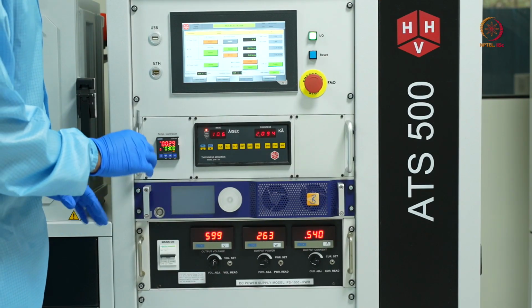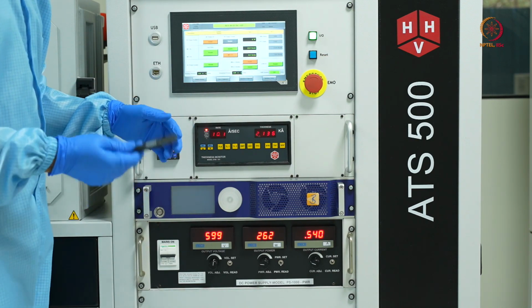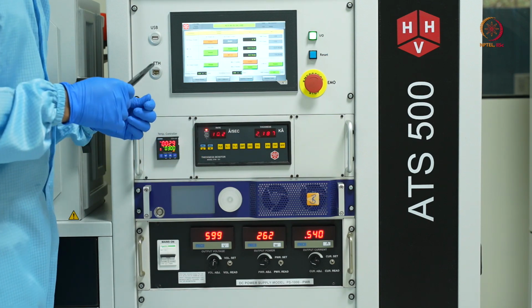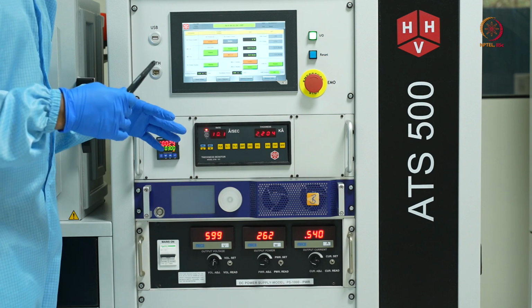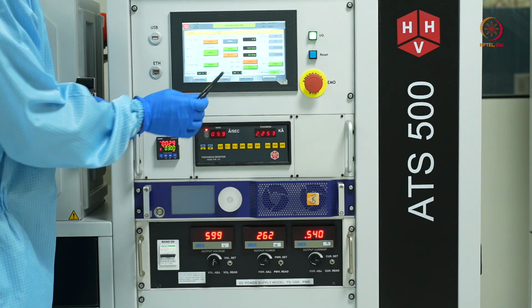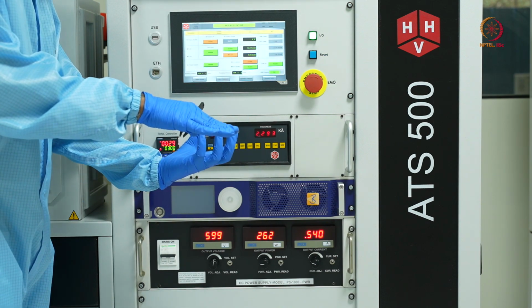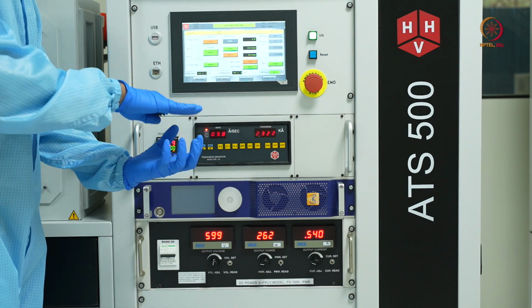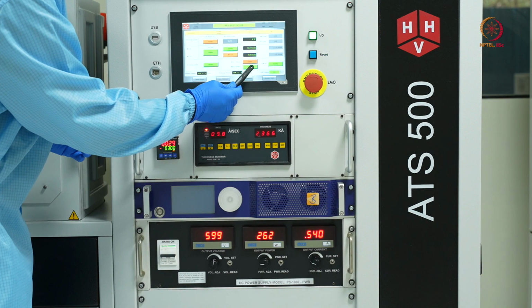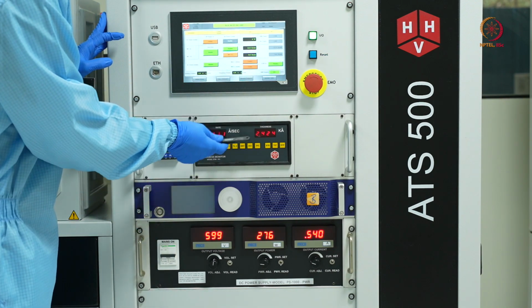So it has been around 5 minutes, and apologies, I said it will be around 100 nanometers, but it turns out the parameters are such that for 5 minutes it will give a thickness of around 200 nanometers. So now I'll just disable that shutter. So what will happen is the shutter will cover my magnetron. So whatever deposition is happening, it will be on the shutter, and it won't be on my sample. I've disabled it, and I'll also disable the DTM now.